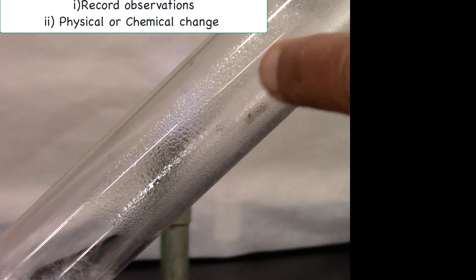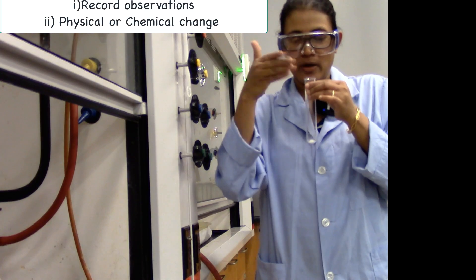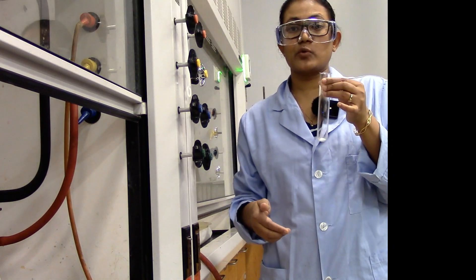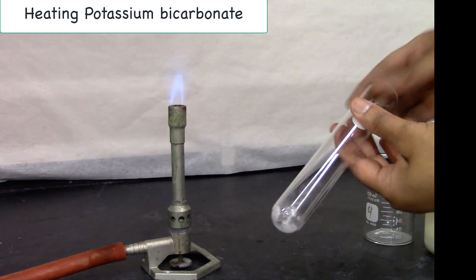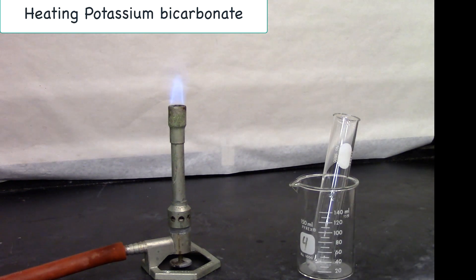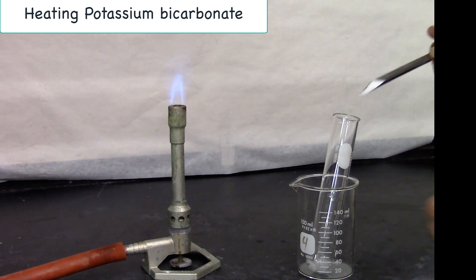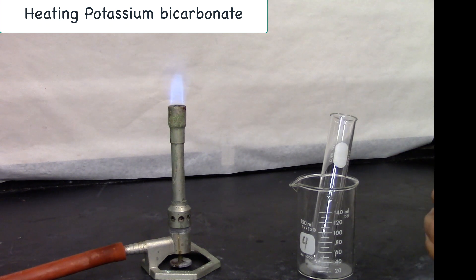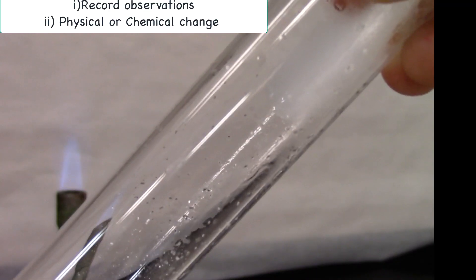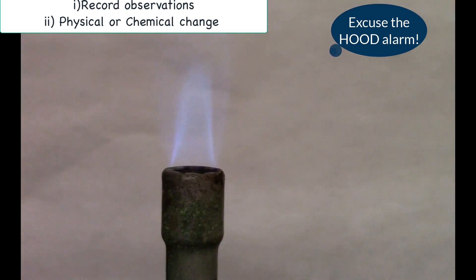You can see some condensation on the top of the test tube. If you take a puff of the gas evolving, it smells like ammonia. For a separate test tube for potassium bicarbonate, I'm going to add a pea-sized amount of potassium bicarbonate. There's some cracking sound and some condensation on top of the test tube.